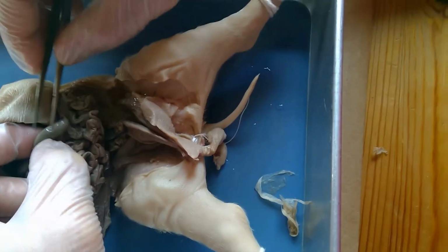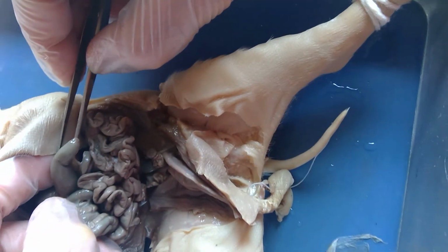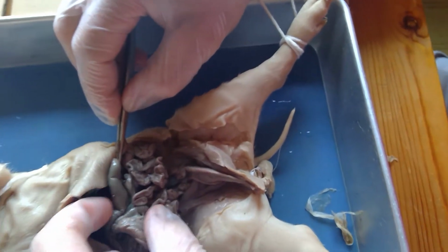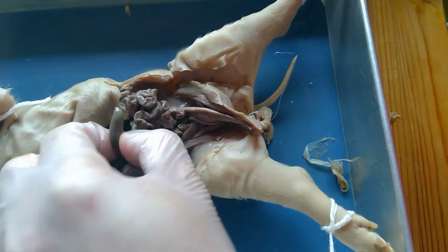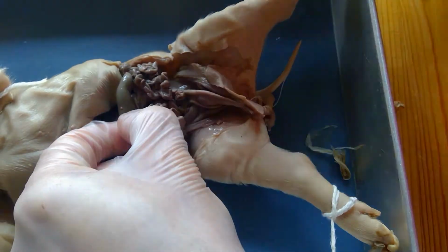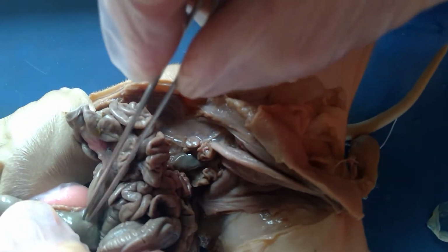One of the things you notice right here, there's basically an end right here. That's called the cecum, and this is something that you don't have. What we have instead of this cecum is called the appendix. So they have a much larger portion if I cut this back. It's basically where the small intestine is going to enter into the large intestine. If I pull this away, you can see right there is the small intestine, and that's where it enters the large intestine.